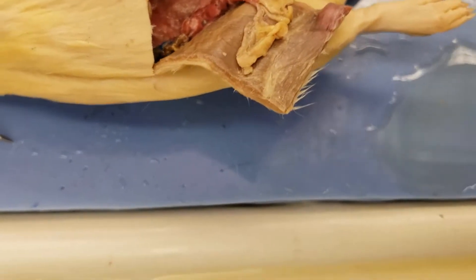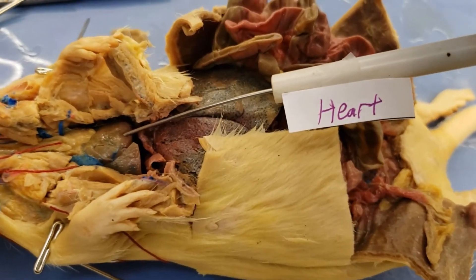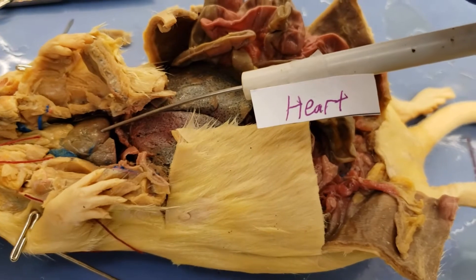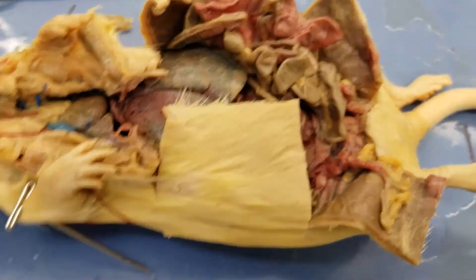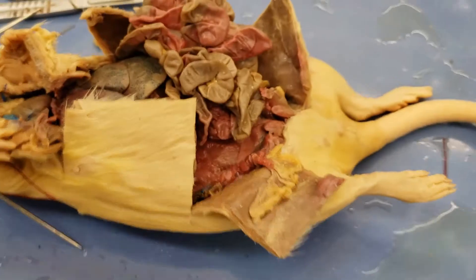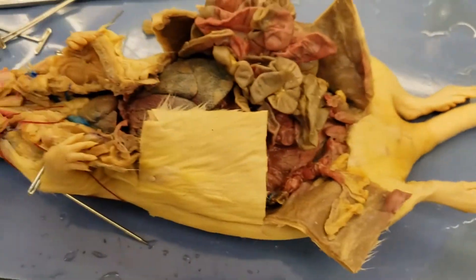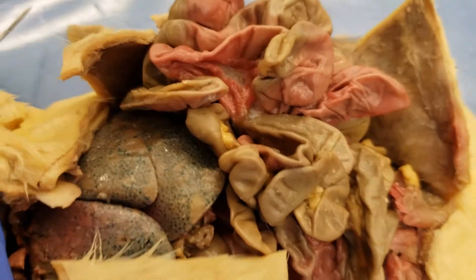Now let's get down to the real stuff. Let's look at the heart. There it is — that's the heart. To the magic of editing, I decided to swap hands so it'll be a little easier to show you the structures. So last up we saw the heart — let's see, there it is.